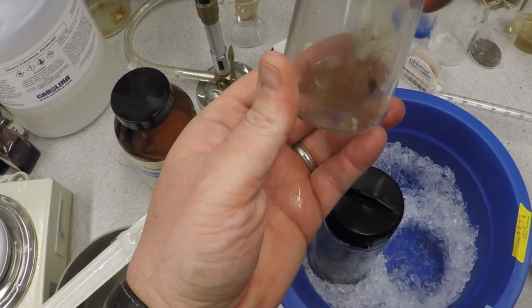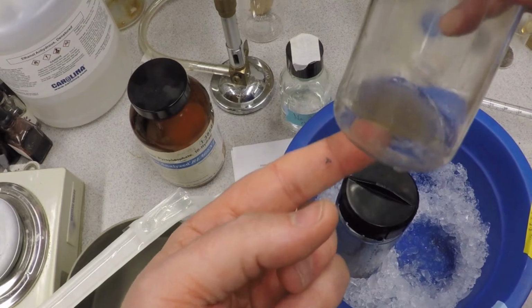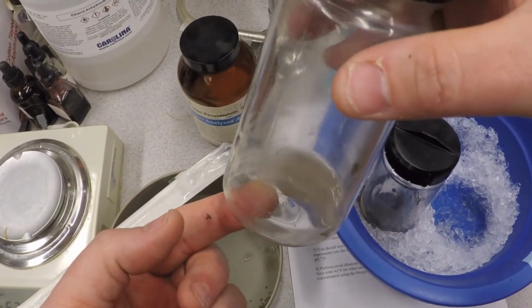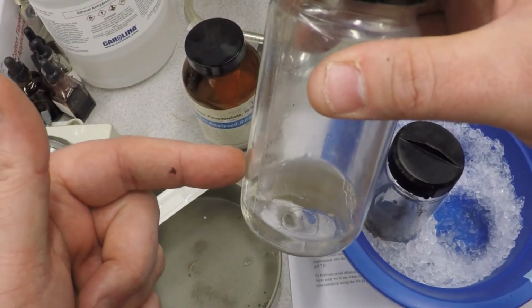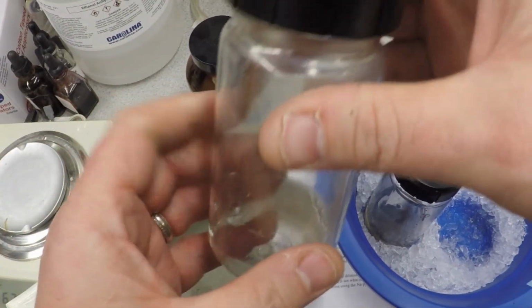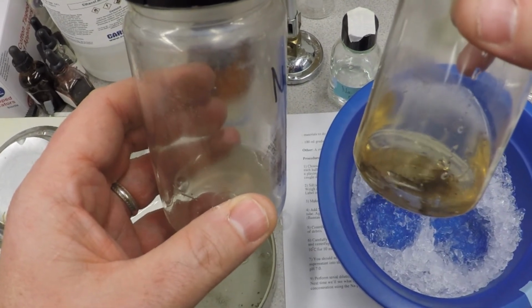So now you now have, in this case, the sodium one, but you now have all that cloudy stuff in there, we hope, is chock full of bacterial goodness. So this is your starting point for doing your dilution series, which is in another video. Okay? So when you dilute this out, you're going to get numbers for CFUs, and you're going to compare it to what you get when you just use plain old phosphate buffer.